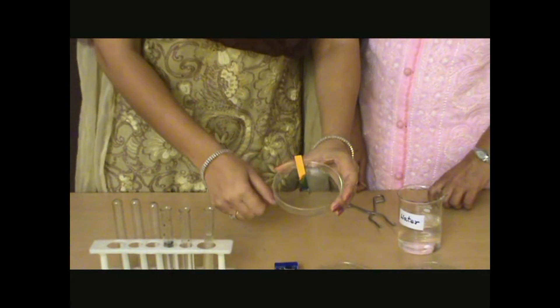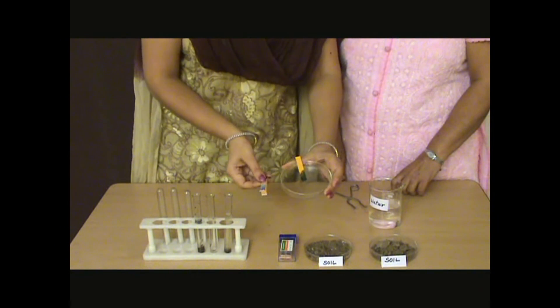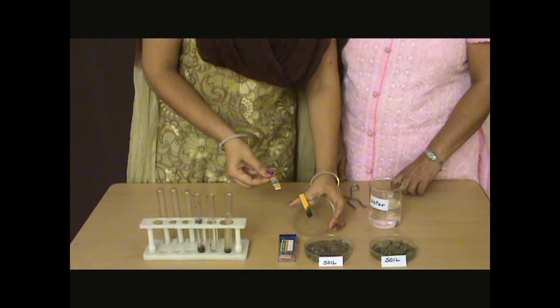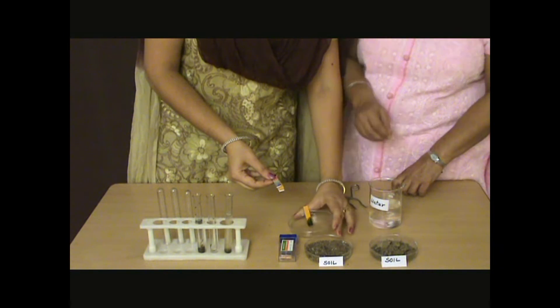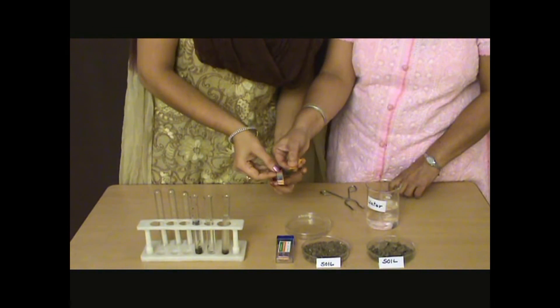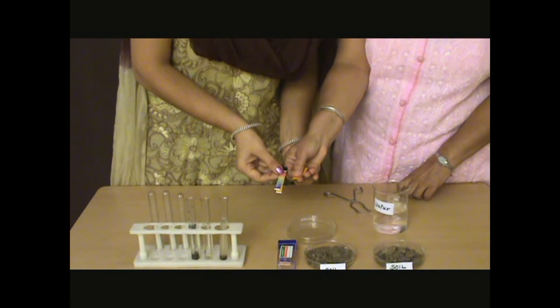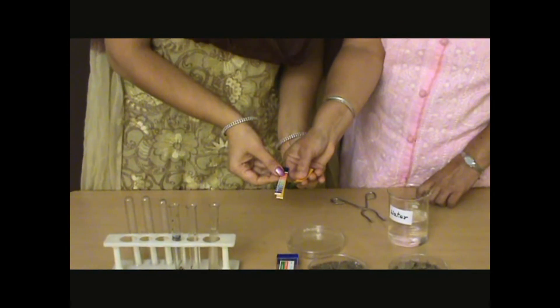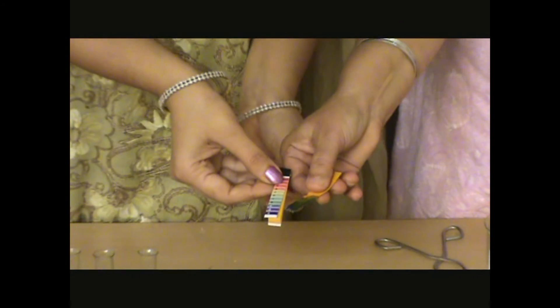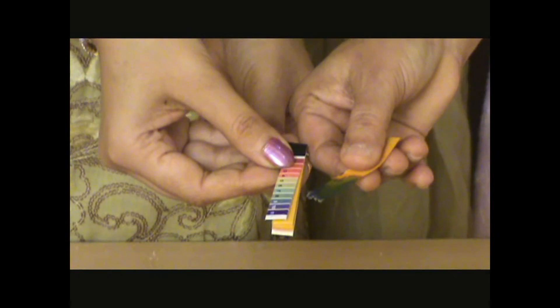Let's compare this colour with the pH chart and see what type of soil sample this is. It's coming around 9. Yes, it's 9.